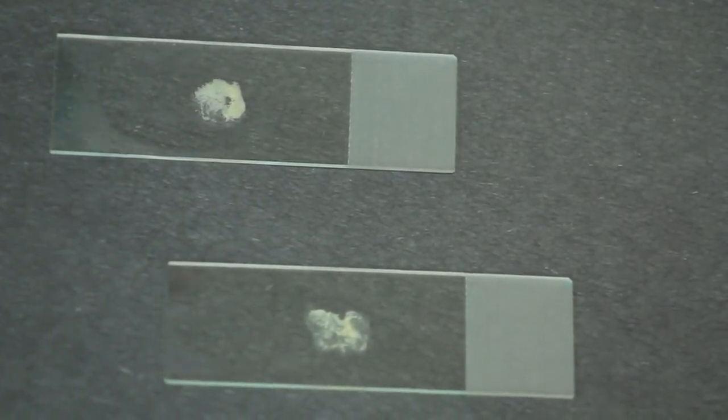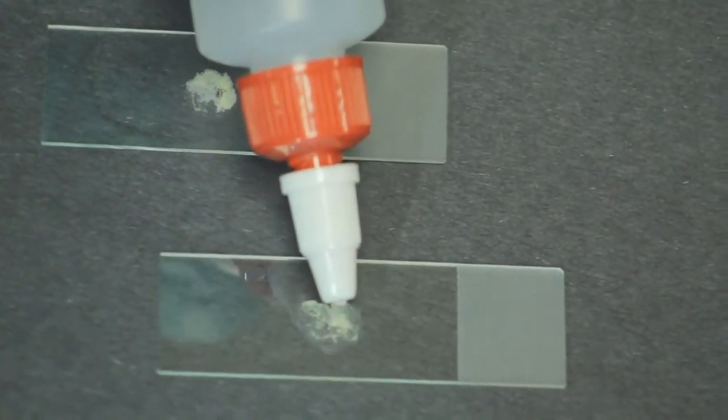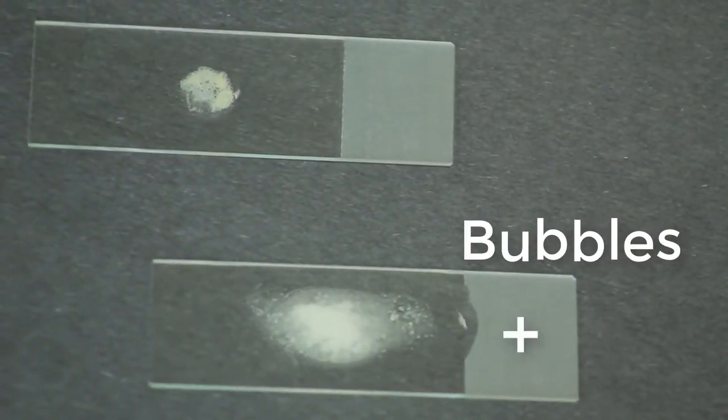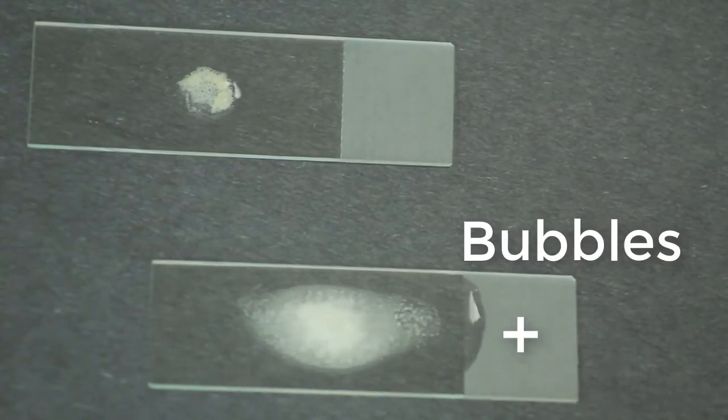This test does nothing in the presence of hydrogen peroxide. This test on the other hand immediately begins to form effervescent bubbles indicating a positive catalase reaction.